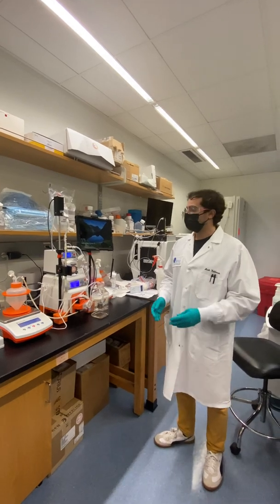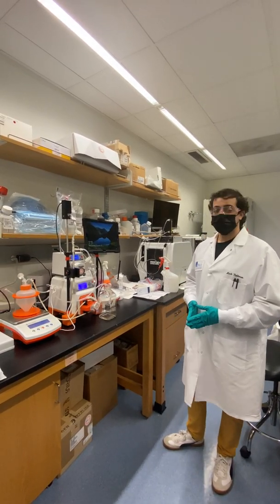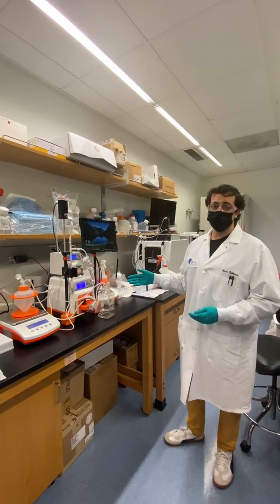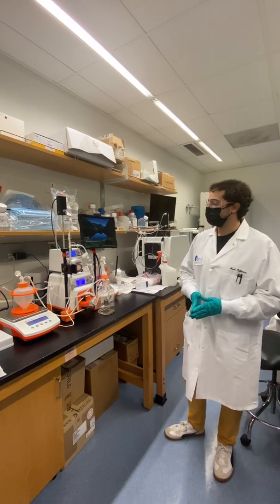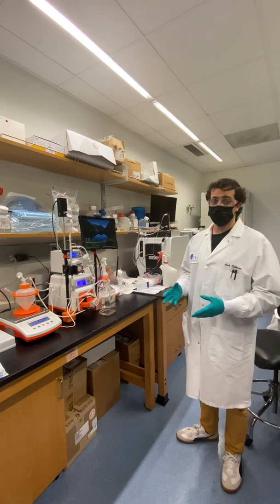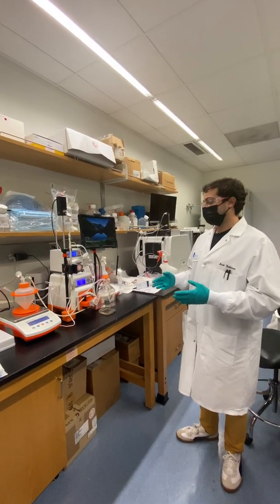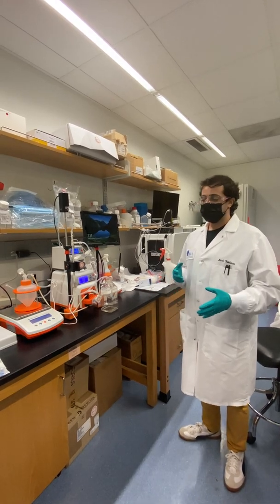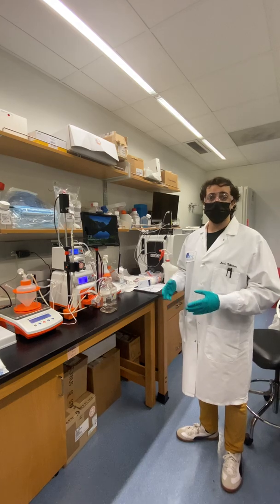Once we complete the characterization of our constructs, we want to purify the samples that we have. We use this machine called the TFF, which stands for Tangential Flow Filtration. This allows us to purify out the virus particles that we created that are the potential vaccine candidates. We use this machine to remove any of the extra cell debris or anything else that's there, so we have just a purified product that we want and nothing else.